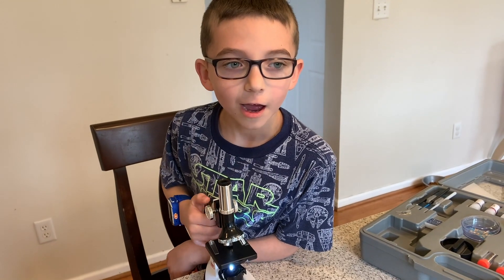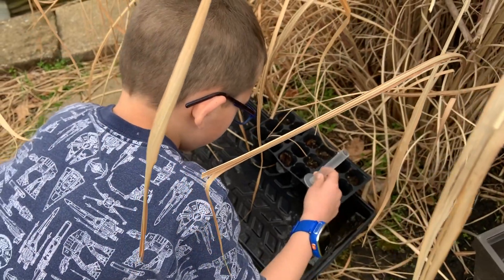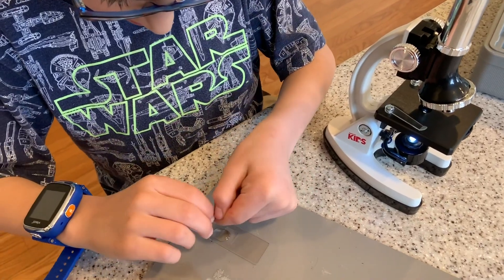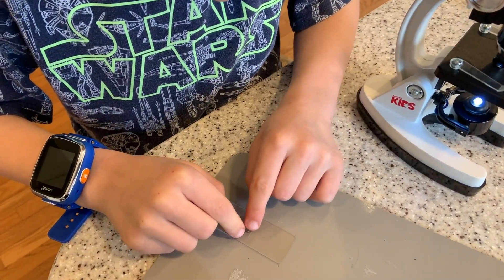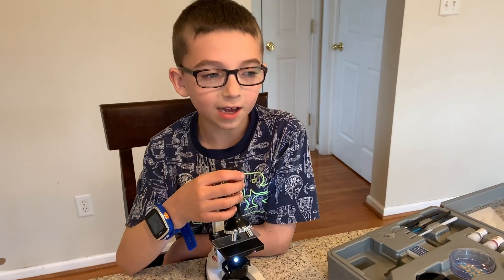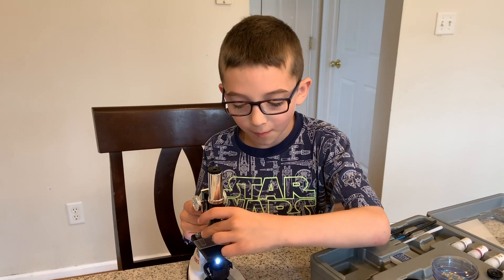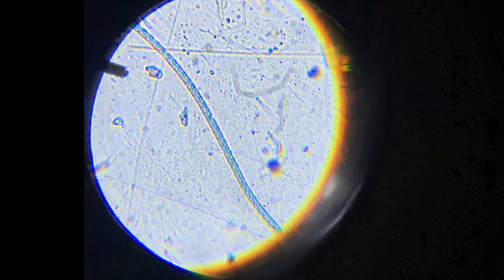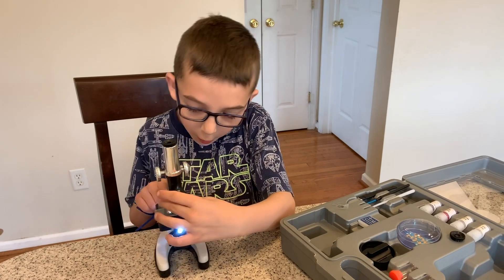What if we look at water from outside? All right, let's go do that. Got it. Whoa, come take a look! Let's take up the magnification. Let's take it up one more time.